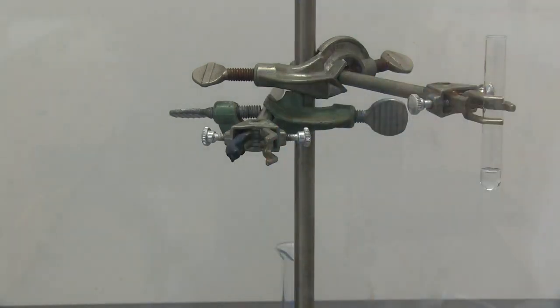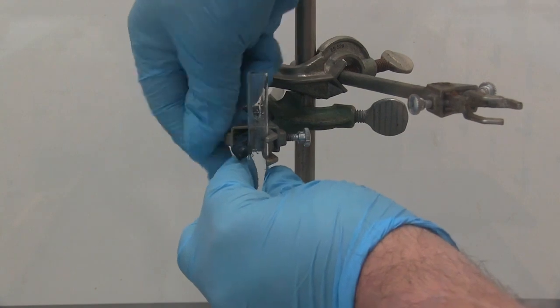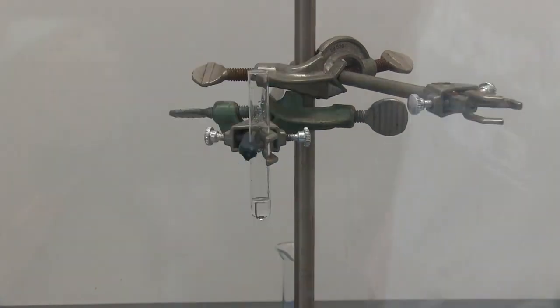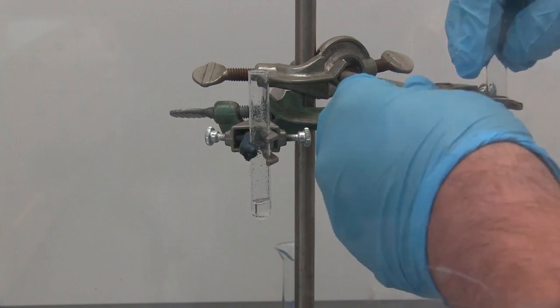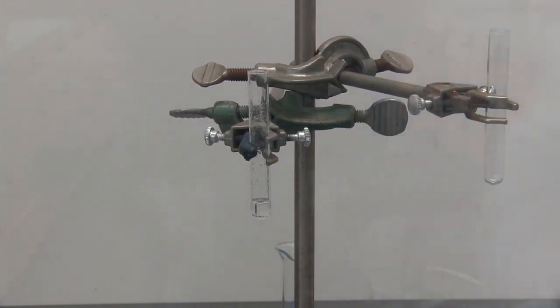Take this one away. Bring over our new test tube, and we're going to dry it with a small amount of anhydrous sodium sulfate. Now that we put our anhydrous sodium sulfate in there, we're going to transfer it one more time to a new test tube and leave behind the anhydrous sodium sulfate.